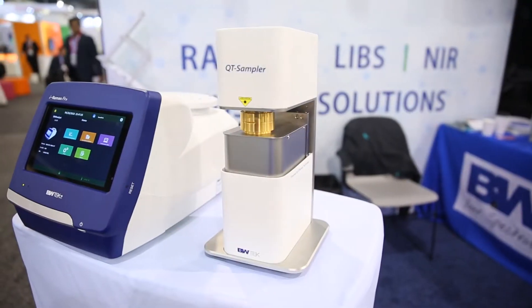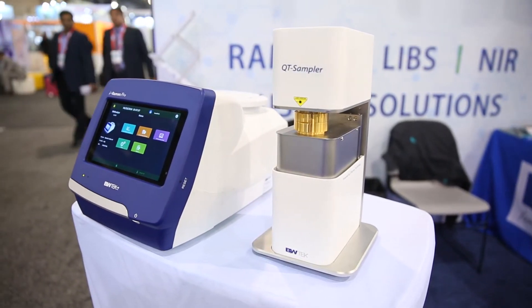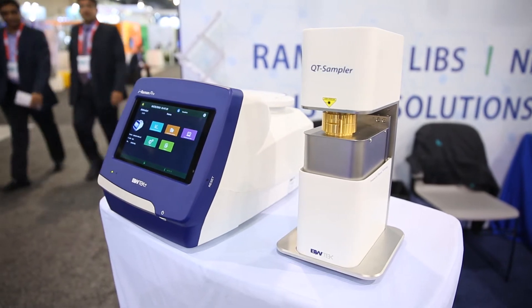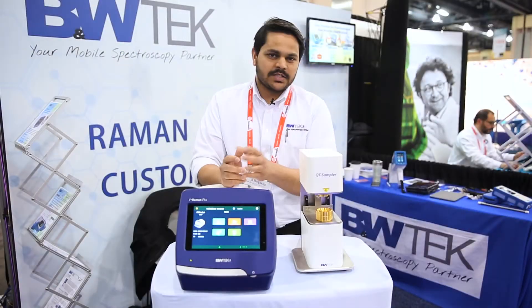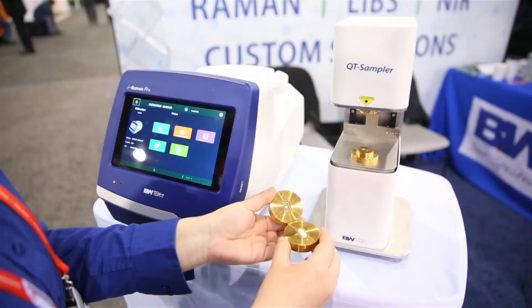It's powered by the ST Raman technology, which allows us to measure extremely high throughput, large spot size transmission measurements in order to accurately quantify the content in your oral solid dosages.